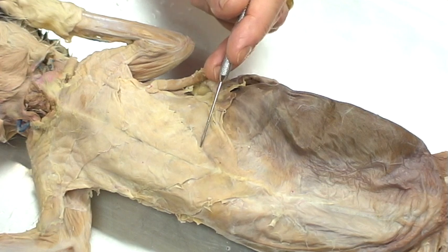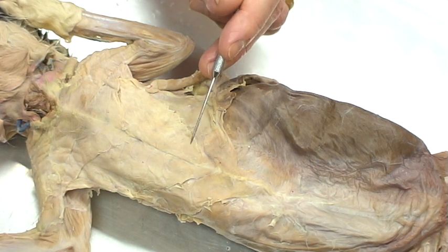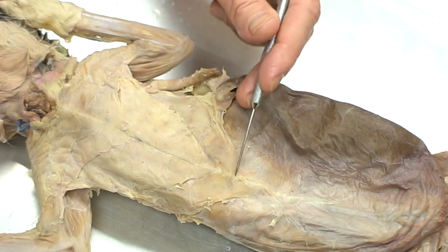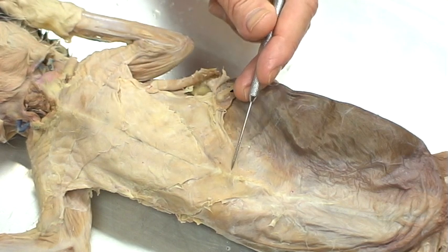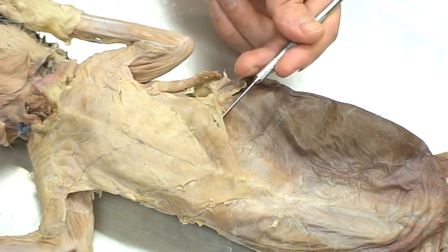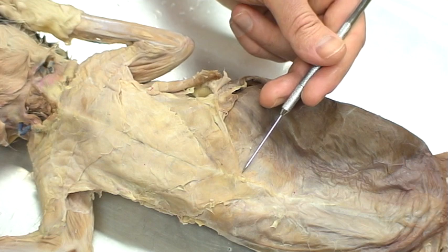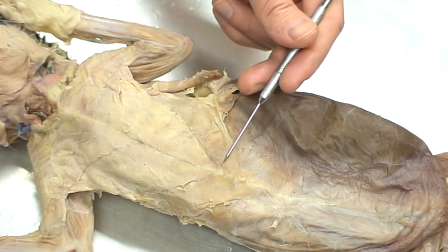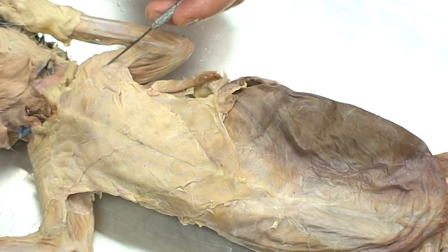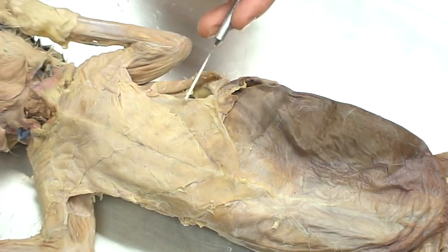The first of these muscles — if you think of the bones underneath, this will really help. What we're seeing is the xiphoid process of the sternum itself. The xiphoid process is down here, the same as on the human. The xiphihumeralis is the first of these pectoral muscles. It runs from the xiphoid process, follows up underneath the armpit, and runs to the humerus itself — so xiphihumeralis.